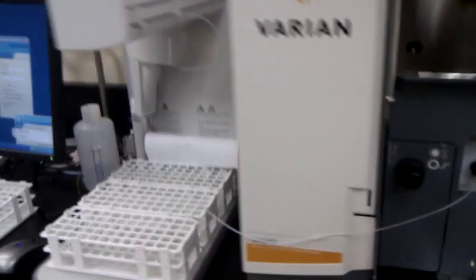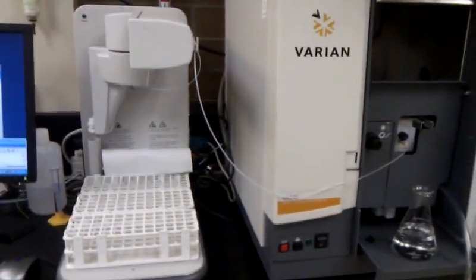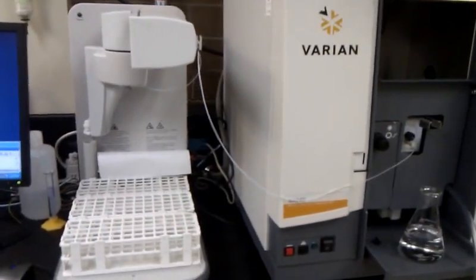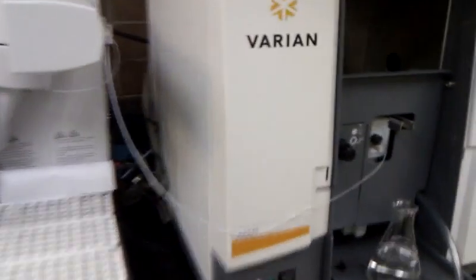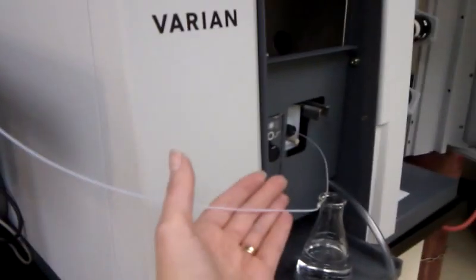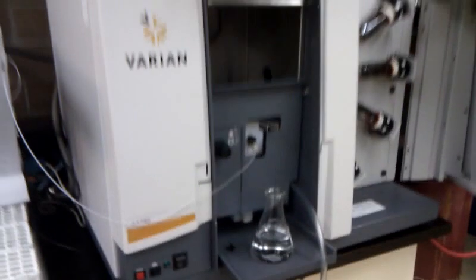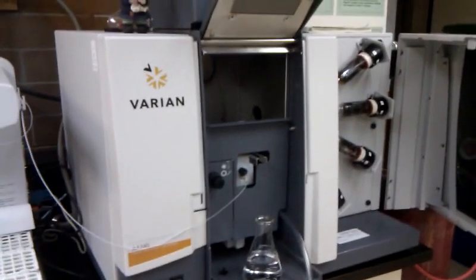If there are no atoms there, we don't see any absorbance. If there are atoms there, we will see absorbance. This instrument is hooked up to an autosampler, so that we can use it over the ILN, which will sample and aspirate selected samples into the flame.